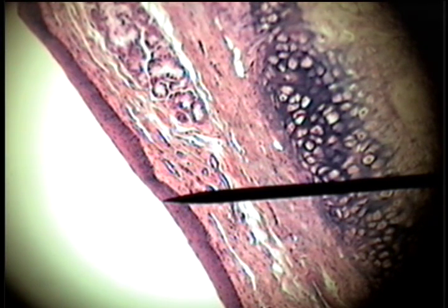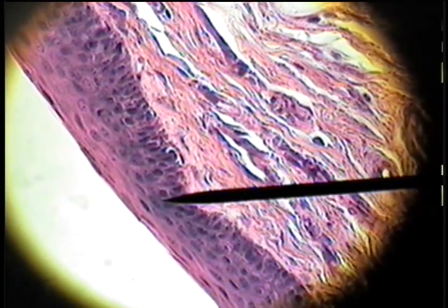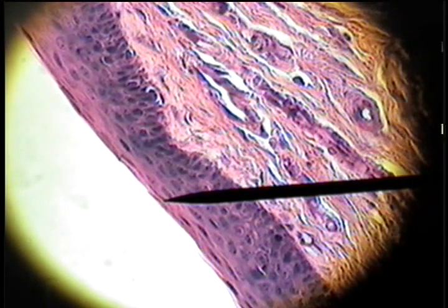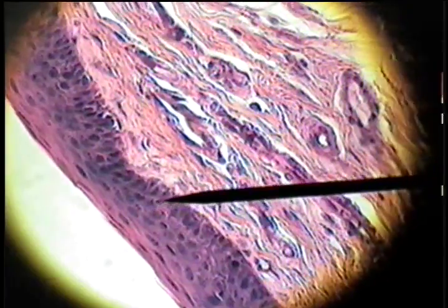A second type of cartilage found as a connective tissue is in the epiglottis, and this is elastic cartilage. Here is the stratified non-keratinized epithelium — so this is stratified squamous non-keratinized epithelium on the epiglottis.